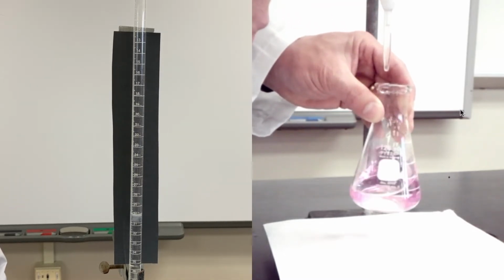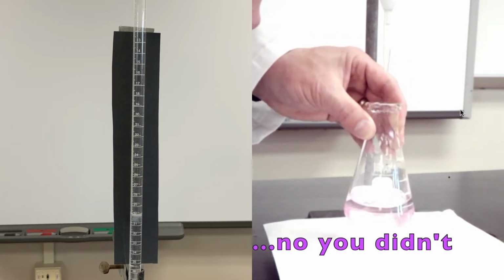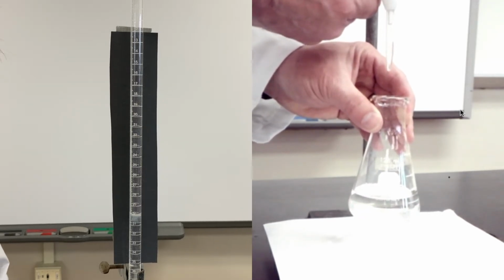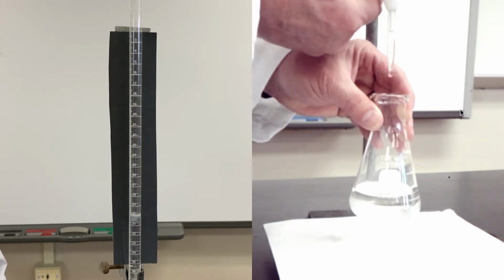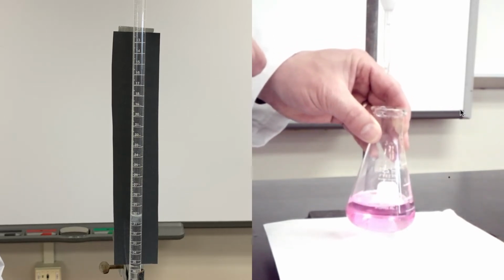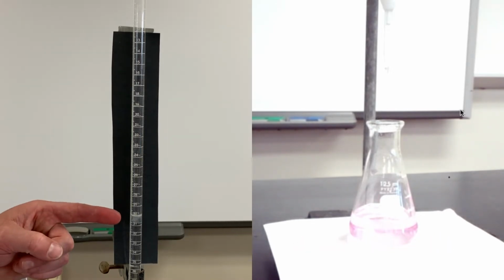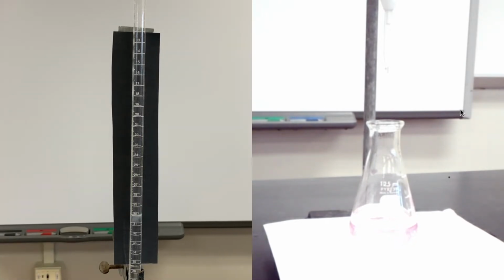Oh, maybe overshot. Definitely overshot. So I'm super close there. You would want to stop right now. I'm going to add one more drop if possible. See if I can get that color to stick around. Let's see what we get. We get that nice color change there. We get that endpoint. Okay, so super important that I notate where I ended up. If I get eye level with my burette here, I can see I'm at 30.1 milliliters. Okay, so I'm gonna jot that down.